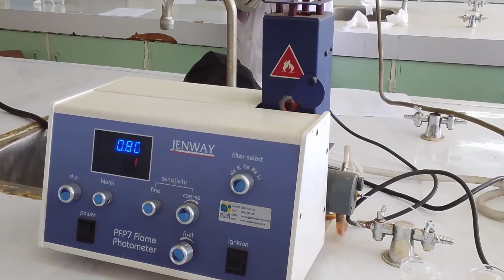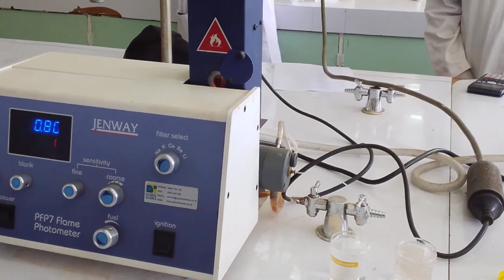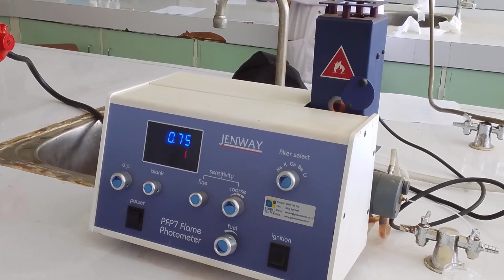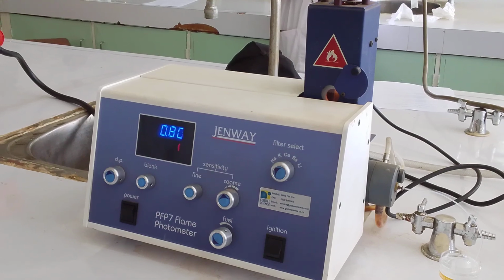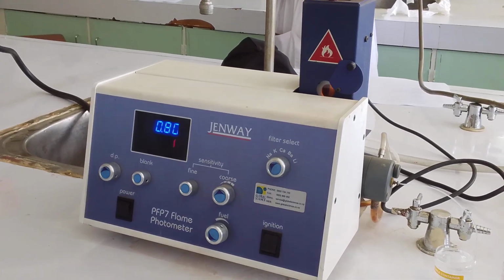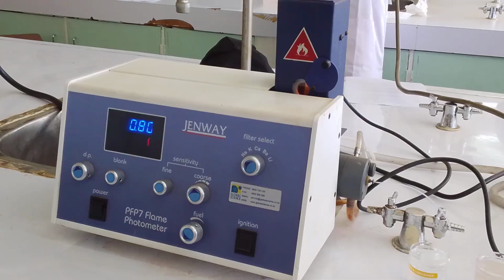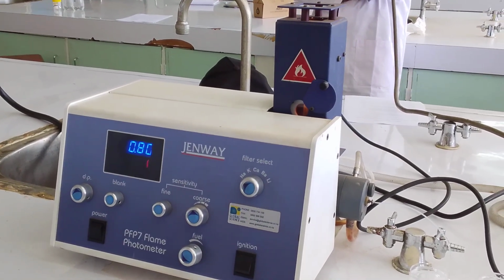Okay. I think that's all I could say. This machine will tell you exactly how precisely you have prepared the sample. By the readings up there on the board, I can already know if you have prepared it well or not. If you're using a measuring cylinder, it should be very exact.